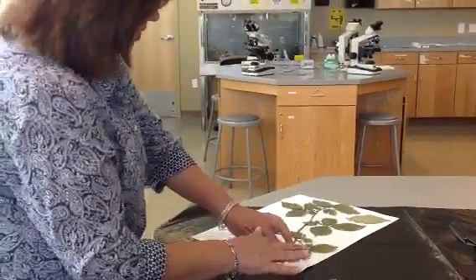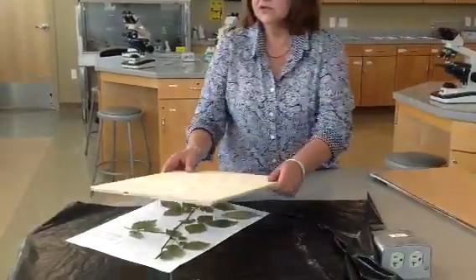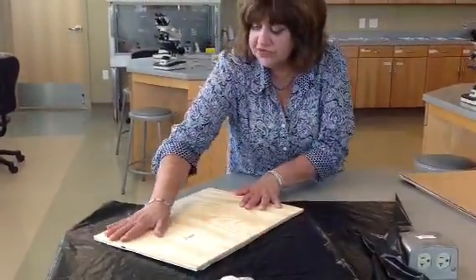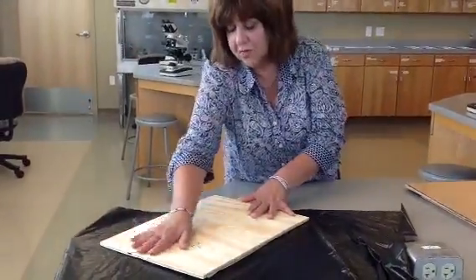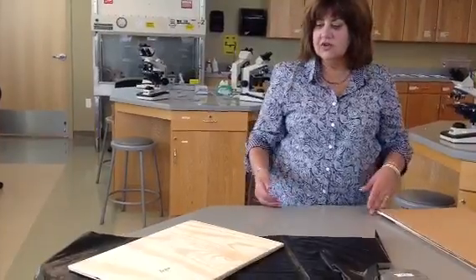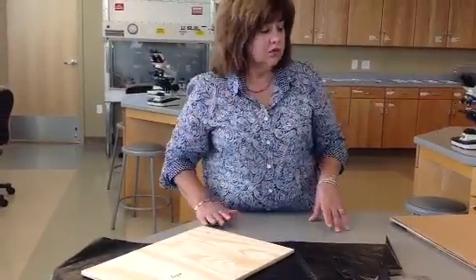You may want to put some weight back on these samples until the glue dries. You should have all of your samples together — five samples, different trees per person — and then they can be turned in together in some sort of a container, or wrapped together with string surrounded by newspaper. When you submit your collection, you should have it bound together in some way.